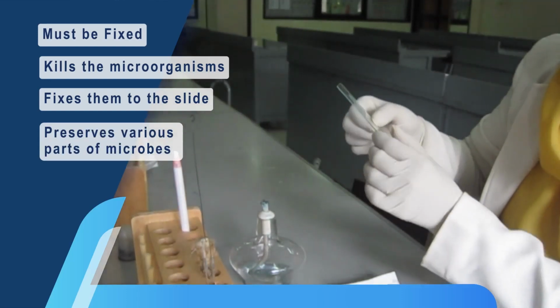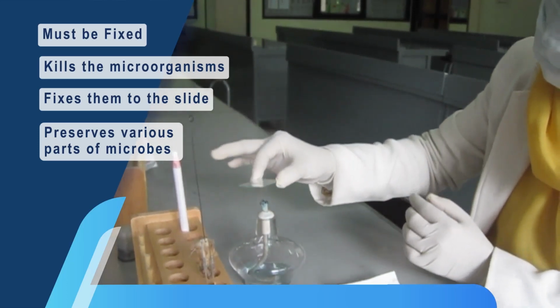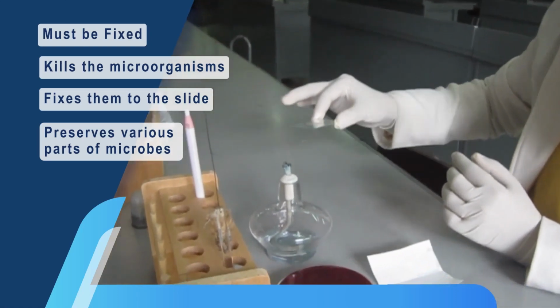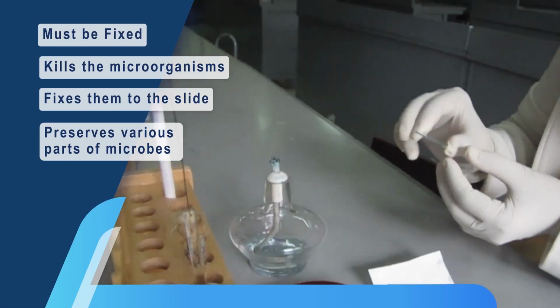Stain is applied and then washed off with water, then the slide is blotted with absorbent paper. Without fixing, the stain might wash the microbes off the slide. The stained microorganisms are now ready for microscopic examination.